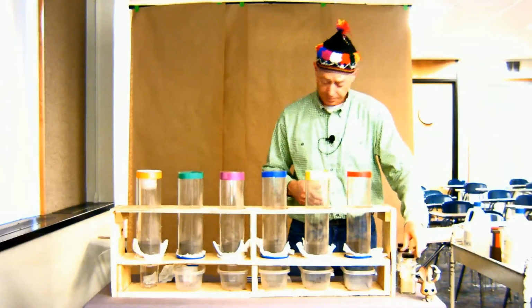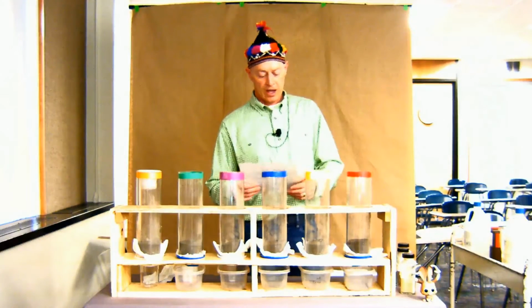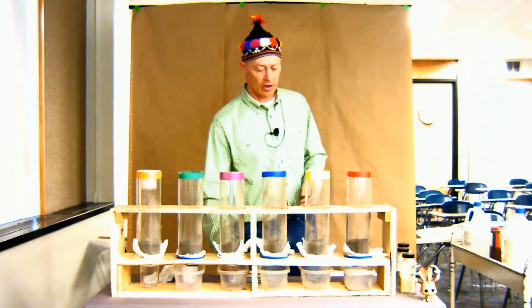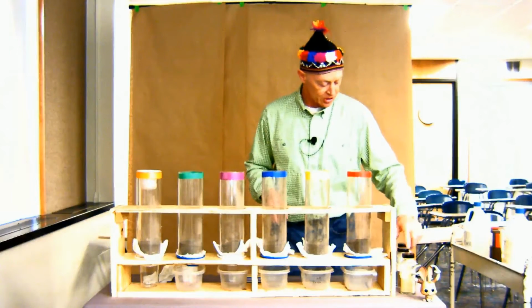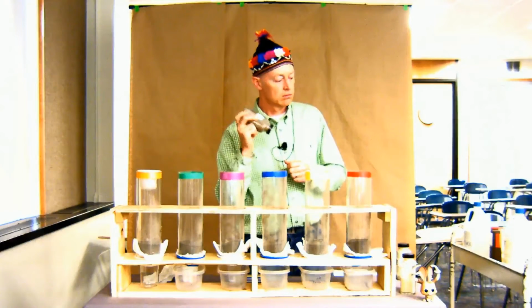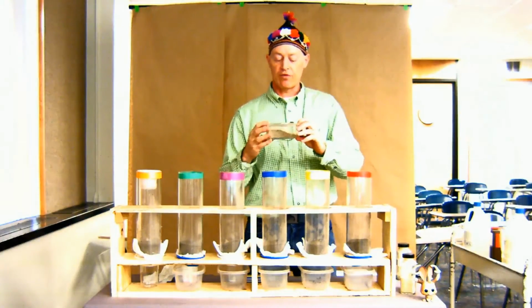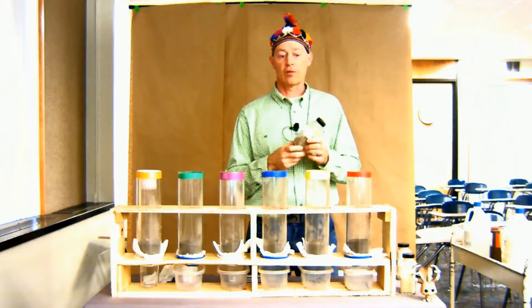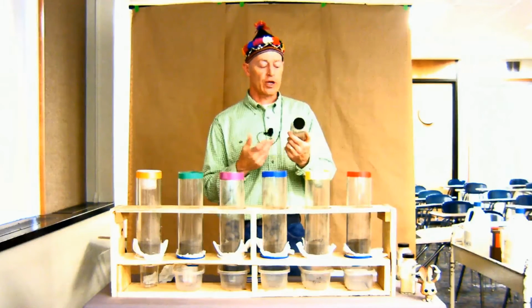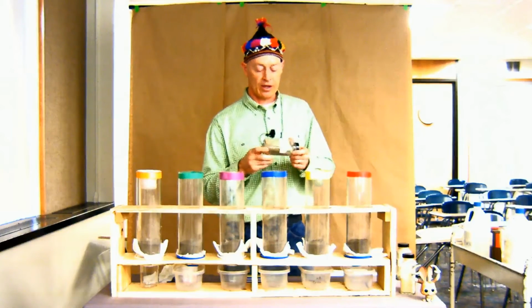pick this up. Okay, the next one is high SAR, the blue one. High SAR, low EC, 10 tons of commercial gypsum. These are pelletized, and then we're going to wash it with DI water. These are your typical pellets. You can hear it. These are pelletized and very common. Most of our live bottom spreaders that throw urea also can throw the pelletized gypsum, and we'll talk about that in a little bit.